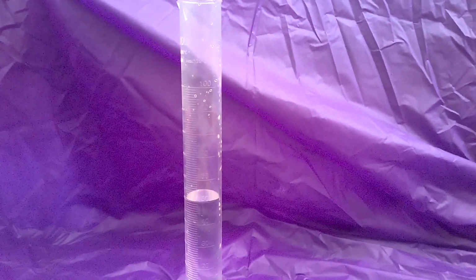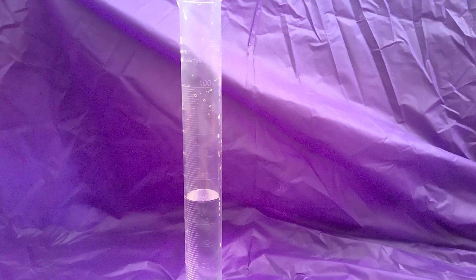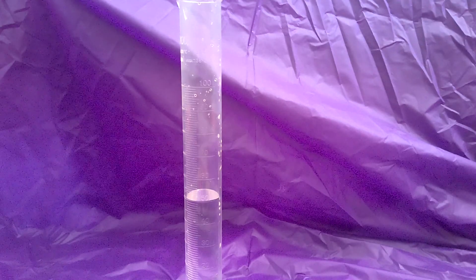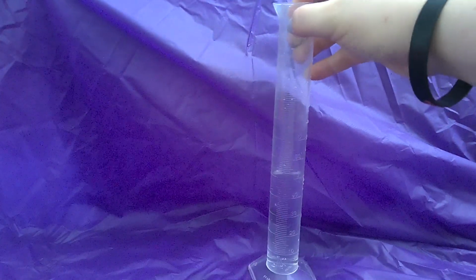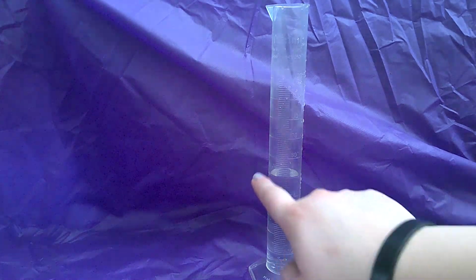So if we go over here. Okay, we talked about this, or you wrote notes on your graduated cylinder. This is called a 100 milliliter graduated cylinder. It goes all the way up to 100 milliliters. And if you took the notes on volume and density, you would have read that this little curved line of your liquid is called the meniscus. You always want to get at eye level to make sure the curvature of that liquid is touching the desired volume that you want.